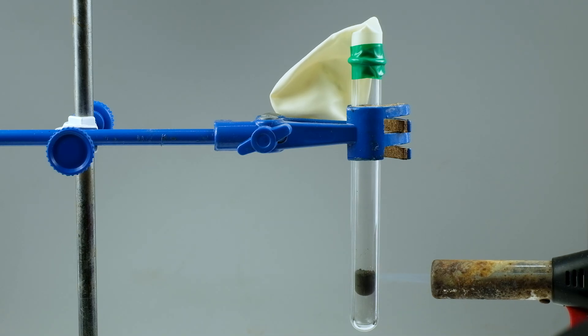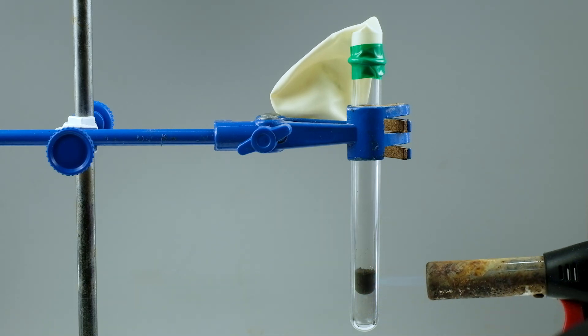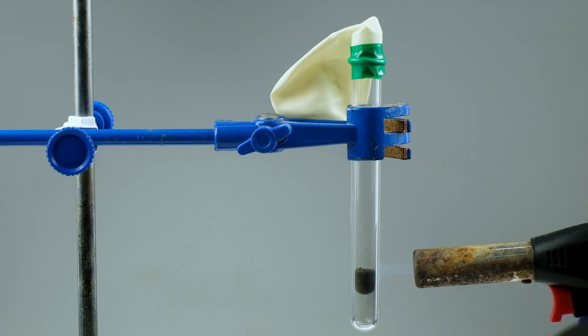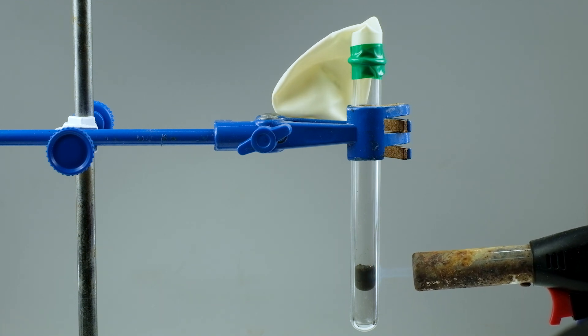The sintered upper layer of titanium hydride prevents the release of hydrogen to the top of the test tube, so we don't see the balloon increasing in volume.